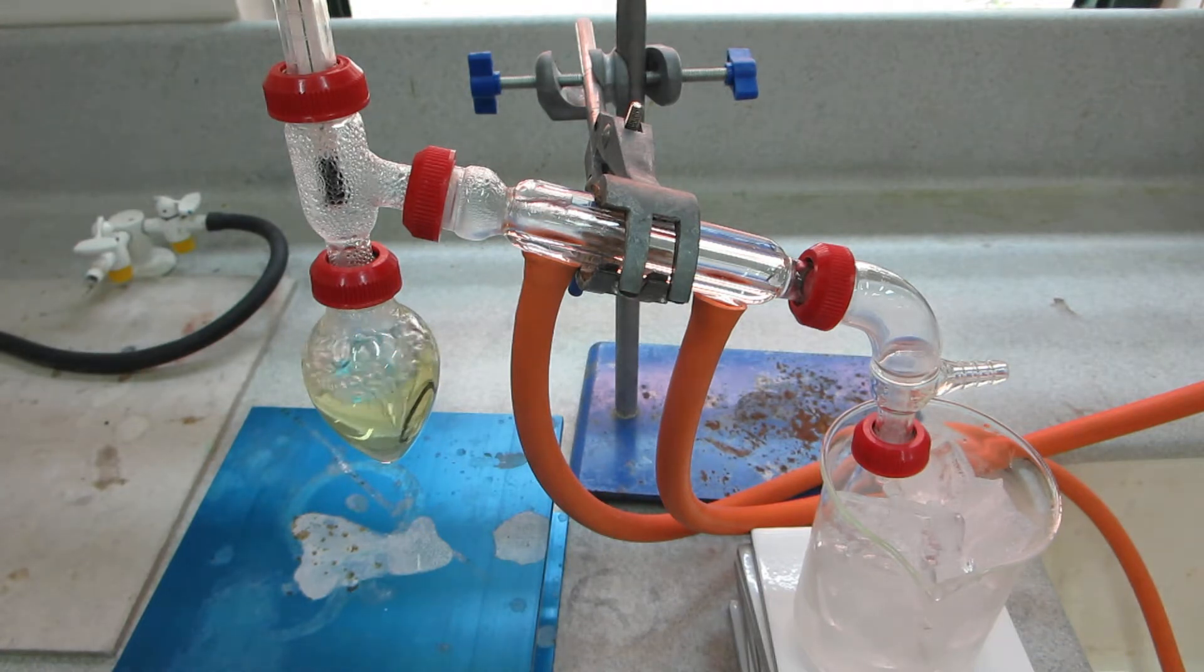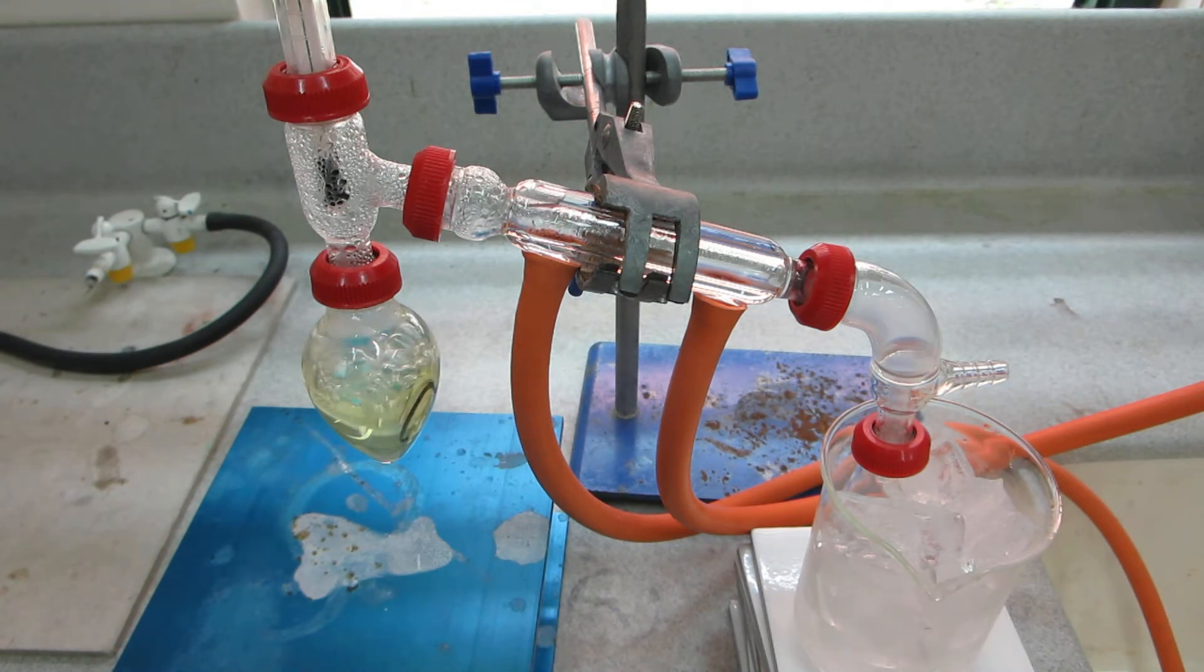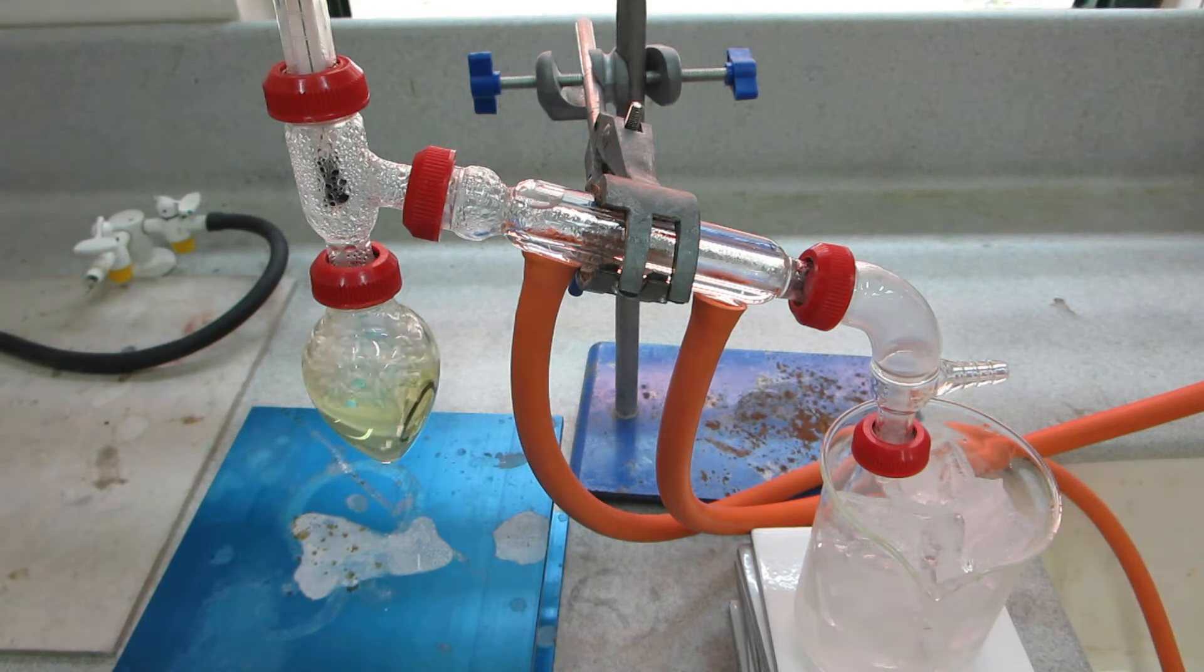70, 80, and you can see some product now starting to come over. We're at 85 degrees, 86 degrees centigrade, still rising.